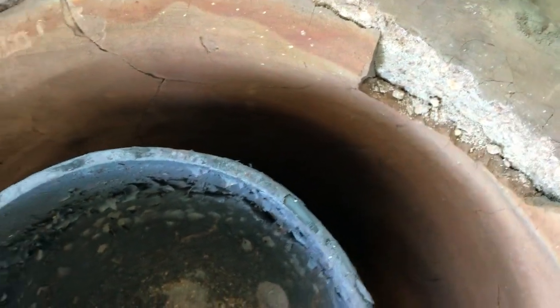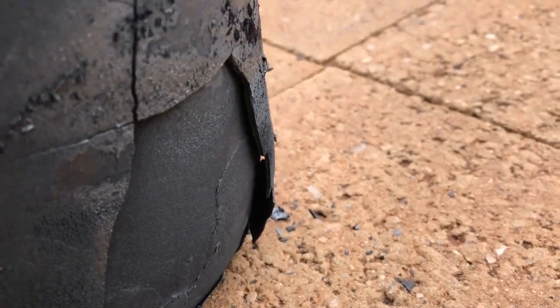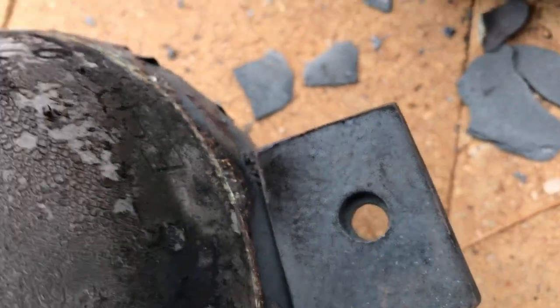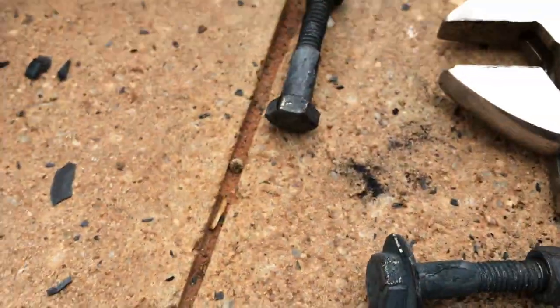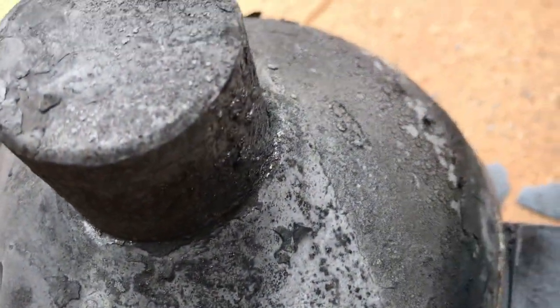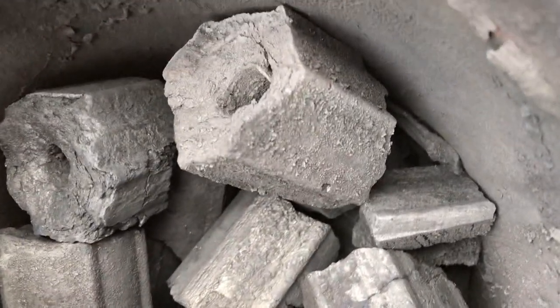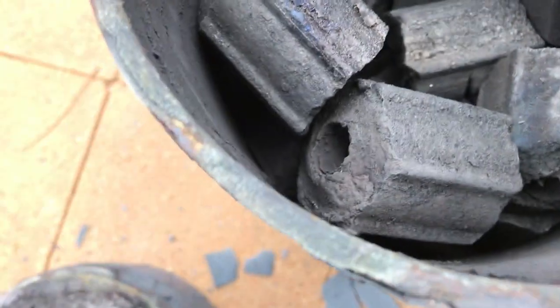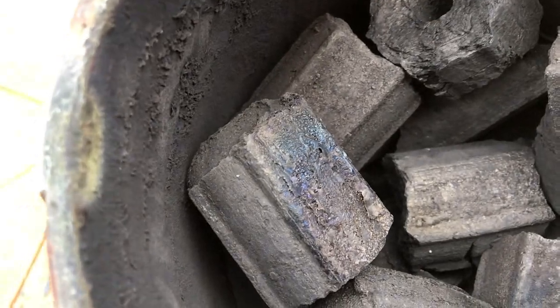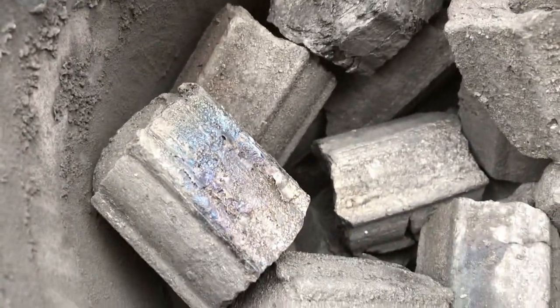I'll unseal it and see what we've got. I just popped the lid on the crucible - the crucible takes a beating, look at the state of the outside, it's got thick layers splitting off the metal. The washers are fused to it and the bolts are sort of elongated, so there's some pressure and carbon buildup. Right down there we can sort of see the carbon felt. I'll fish all those things out and check them with the multimeter in a minute.